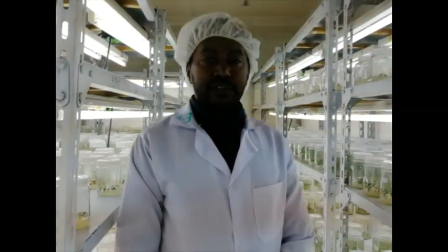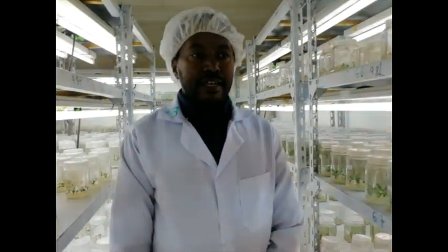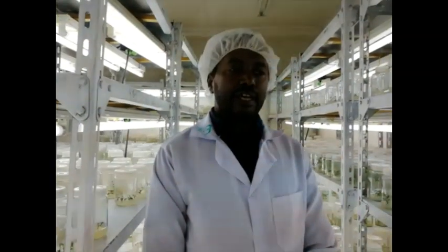So in the following consecutive videos, I shall demonstrate 3 steps. The first one is explant sterilization, in which we use sodium hypochlorite, ethanol, and Tween 20. After cleaning the explants, we directly transfer them to primary callus initiation media. Then we keep them for 30 days, after which we transfer them to the embryogenic callus induction media. Here we identify embryogenic callus using morphology only.